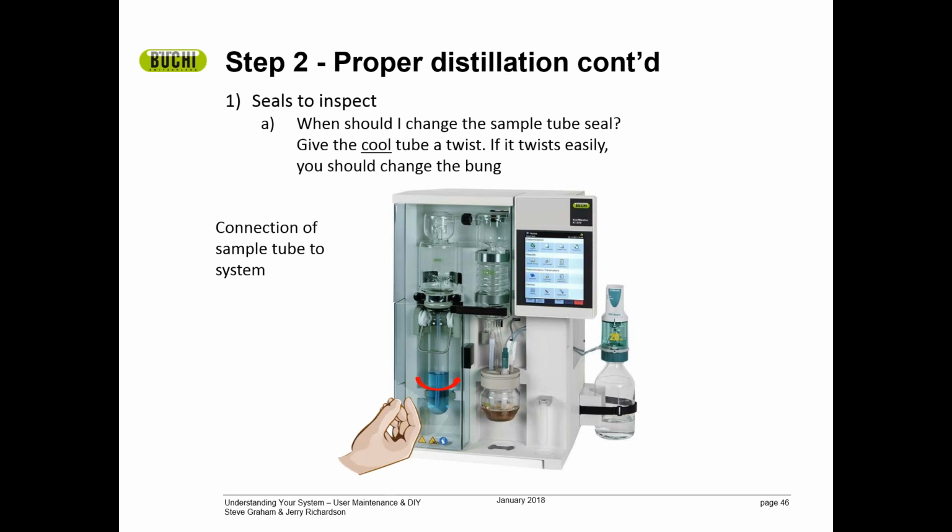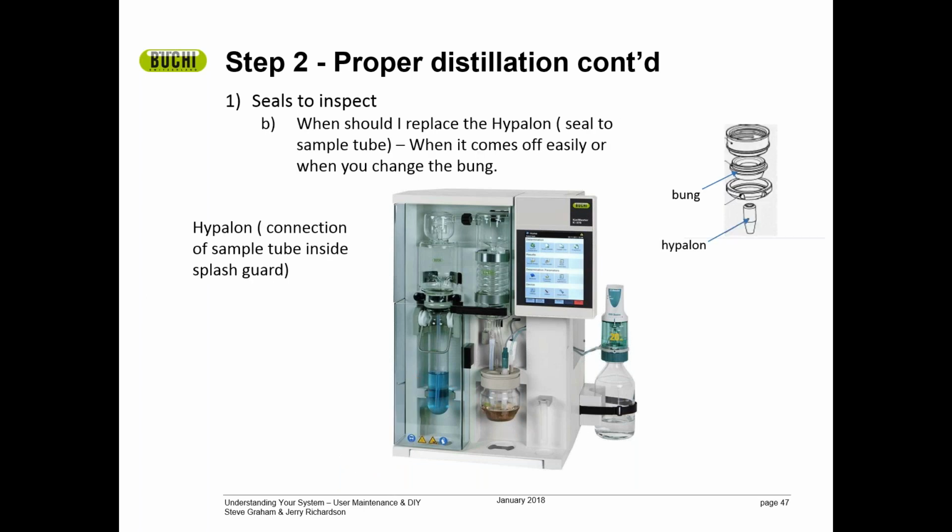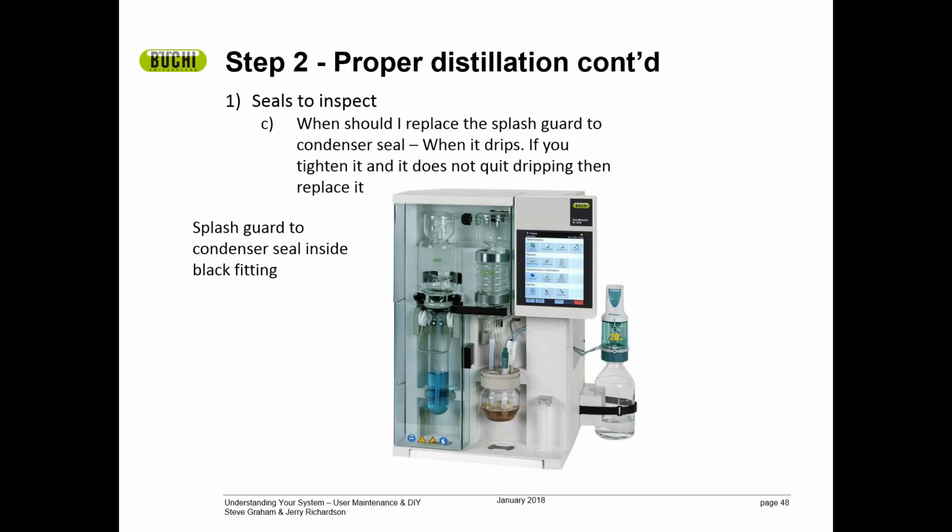We'll have a video that shows this better, but basically all you need to do is have a cool sample tube on the system and twist it to find out if you should replace the bung. If you can twist the sample tube easily, you should replace it. When you replace the bung, you need to replace the hypalon in the splash guard at the same time.